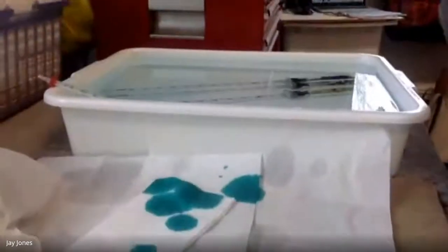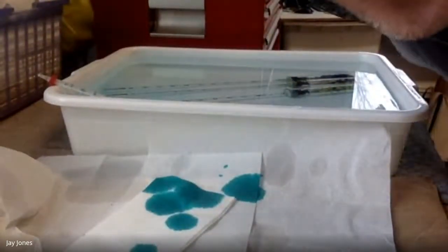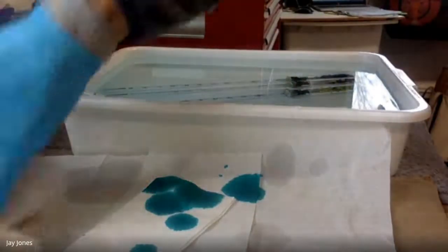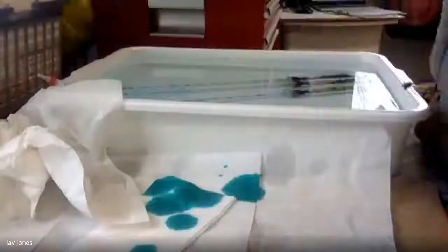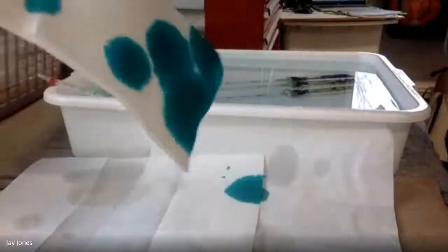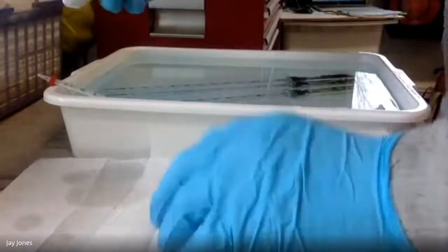Okay, so in 3 minutes, we're going to do it again. So right now it's 11:43. At 11:46, we're going to take another reading. Set my timer. Okay. Clean up a little bit. It's like I didn't use red. It looked like a crime scene.